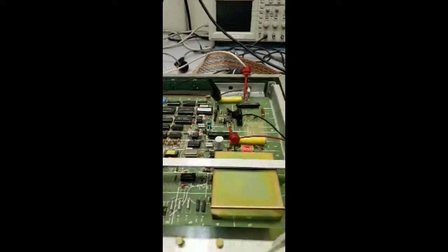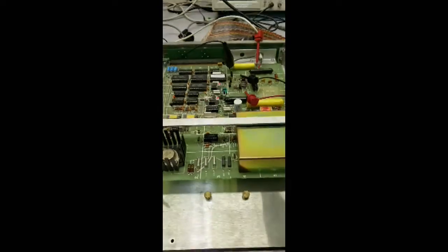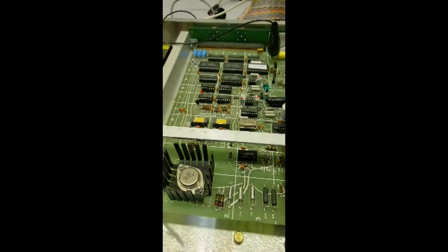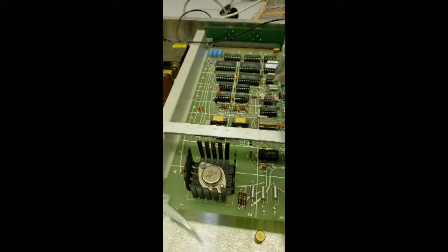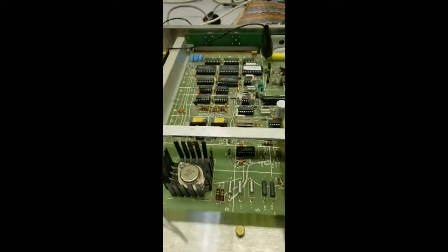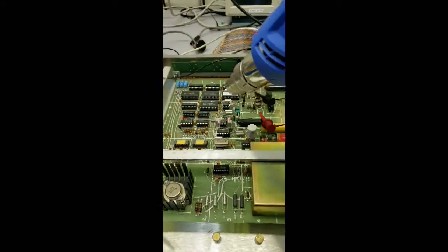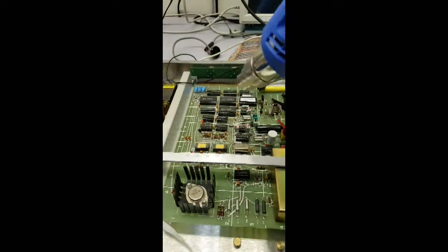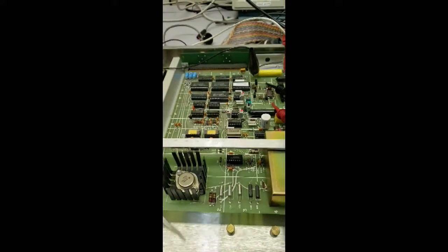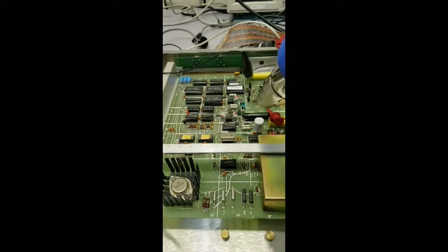It's nice and quiet, it's working, it's very stable. We're going to take some heat and try to heat up some components and see if we can get this to fail. I know from experience that it's over in this area somewhere. I'm having the heat gun on low. I don't want to overheat it to where I'm melting components, but I want to cause this mode of failure, which is oscillation and clicking.